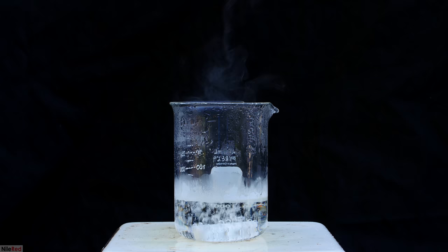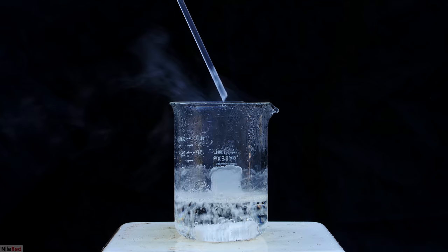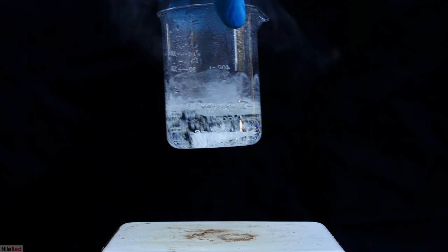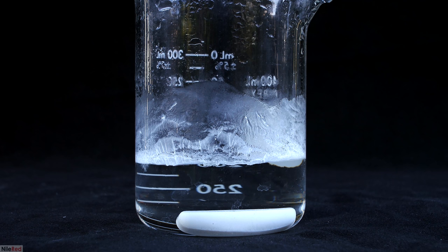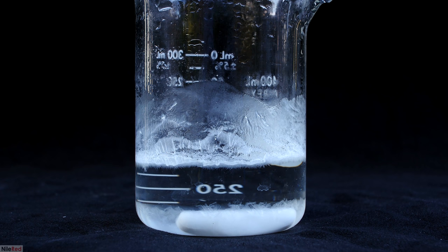The liquid we have here is mostly trimethylamine hydrochloride with a little bit of water. This is an important point to make, because although I don't know how hot the solution actually is, it's definitely well above 100°C. Handling it in the wrong way could easily lead to a pretty nasty burn. The solution is allowed to sit and cool, and crystals of trimethylamine hydrochloride will slowly start to form.